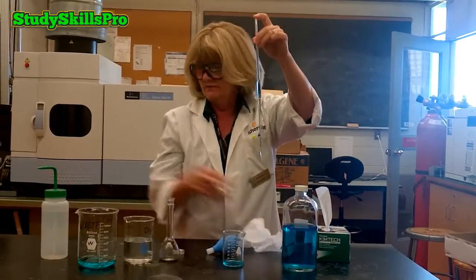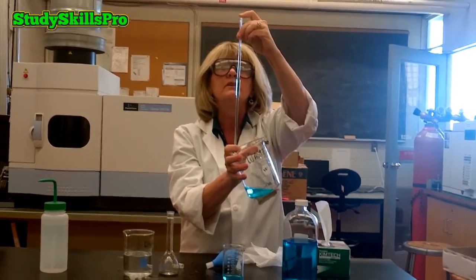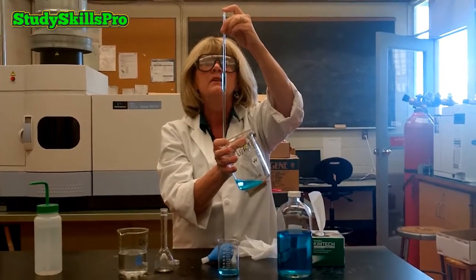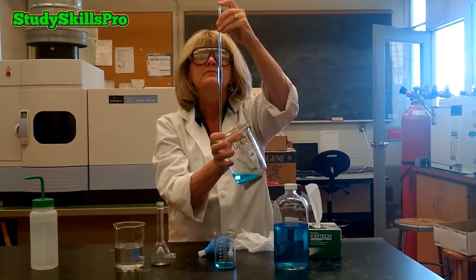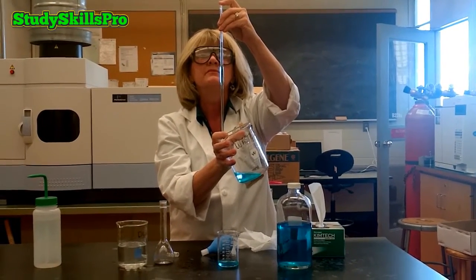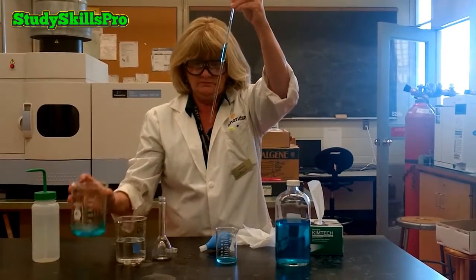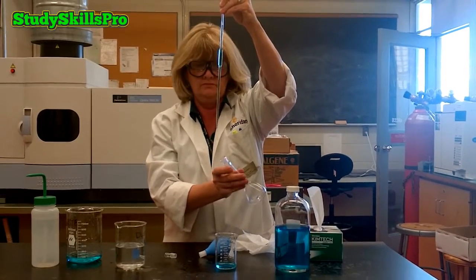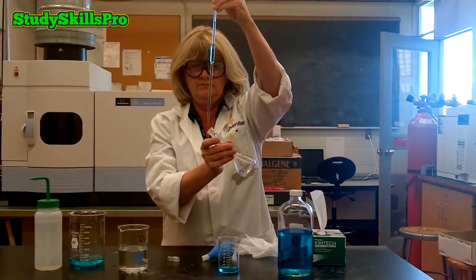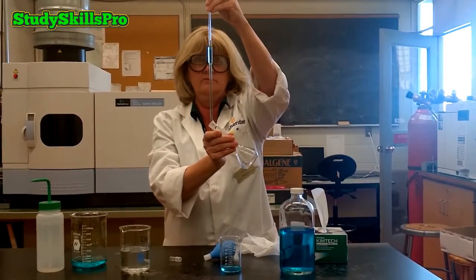You will note that your dry index finger is used to hold the top of the pipette. You will also note that we used a Kim wipe in order to wipe off the tip of the pipette. You then allow the solution to drain in the volumetric pipette until the meniscus is touching the calibration line on the volumetric pipette. You can now transfer your solution to the volumetric flask.